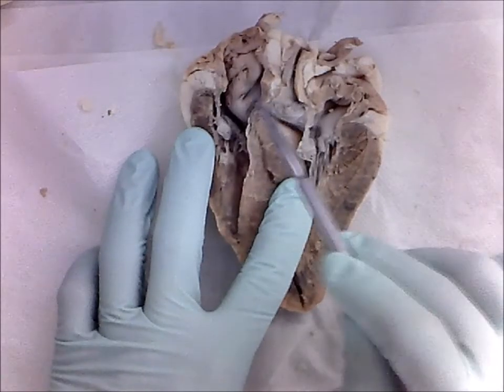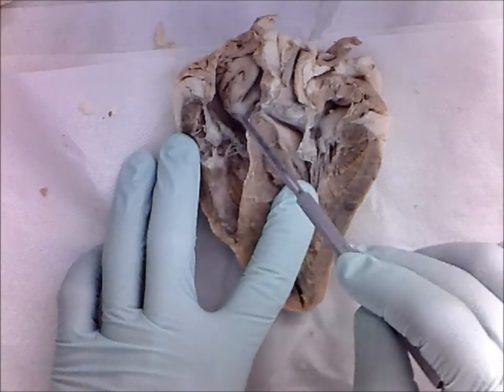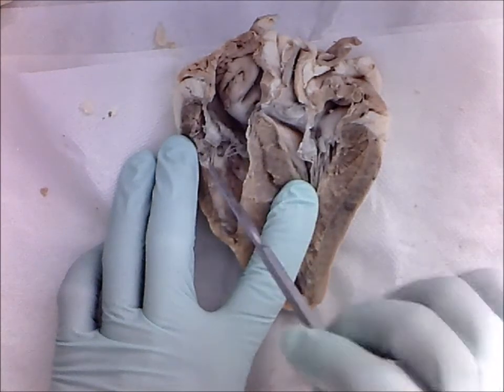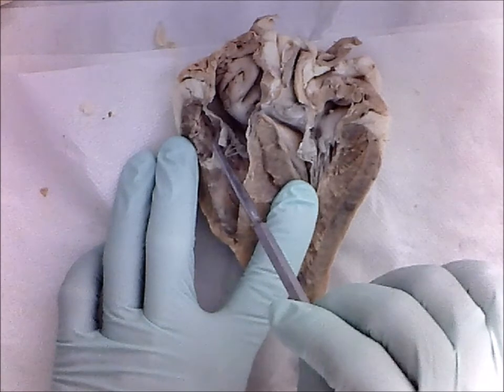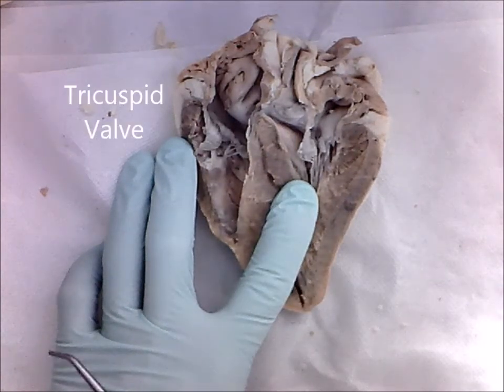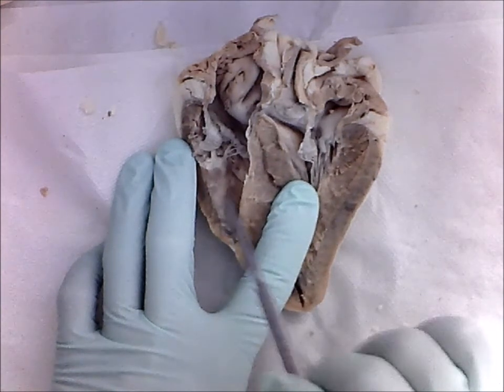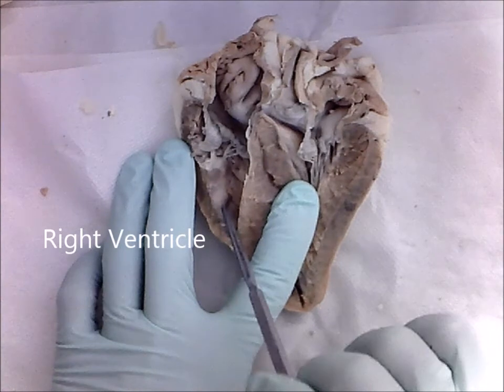This is the right atrium. Right atrium pumps blood through this valve right here. This is called the tricuspid valve. From the tricuspid valve, blood is pumped into this chamber here, called the right ventricle.